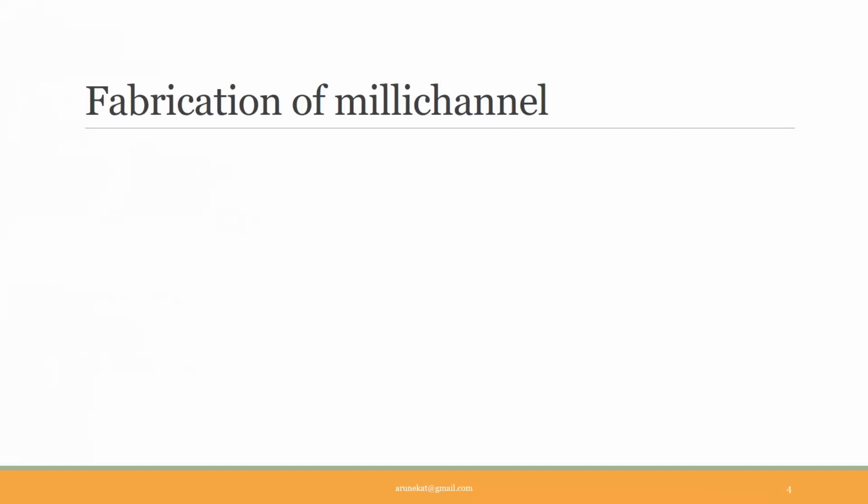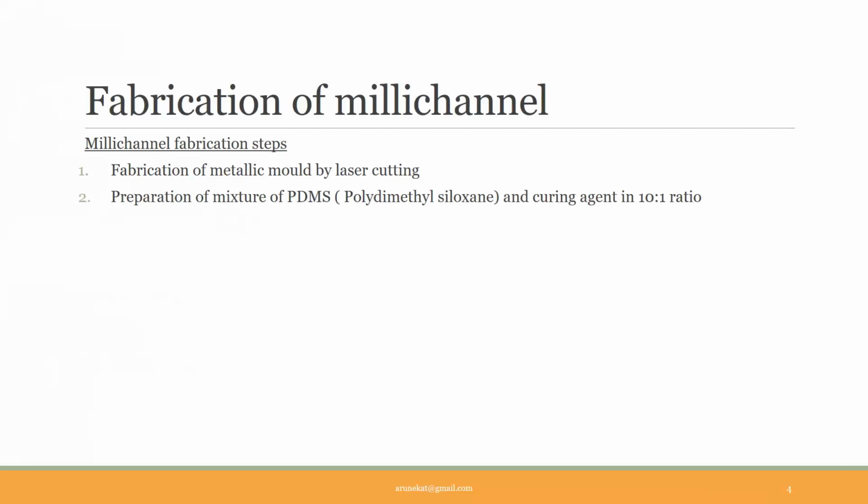Now, I'll come to the fabrication of millifluidic device. We fabricate the device using a transparent soft material called PDMS or polydimethyl siloxane. The fabrication process can be divided into many steps. First, we have to make the mold of the device. We can prepare the design using a CAD software, and the design can be cut from a metallic sheet using a laser cutter. Now, we prepare a mixture of PDMS and curing agent in the ratio 10:1. The weight of the mixture depends on the size of the channel. This mixture has to be degassed in a vacuum desiccator to remove all the dissolved gases.